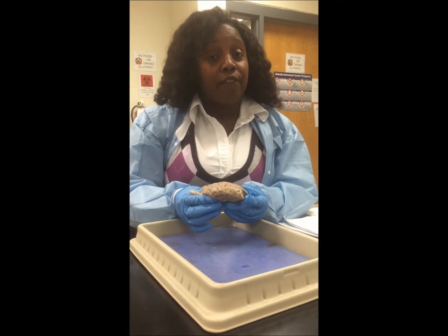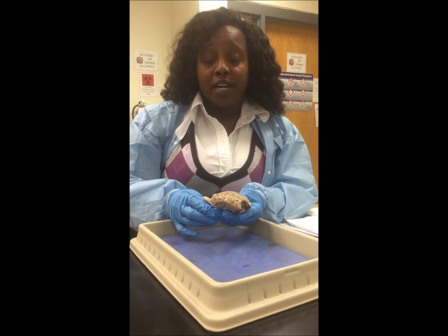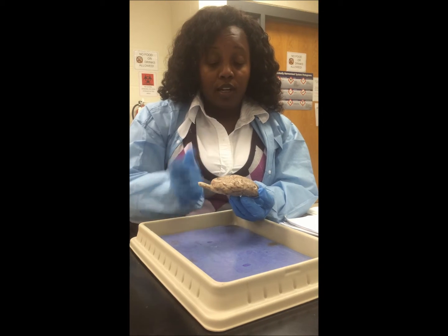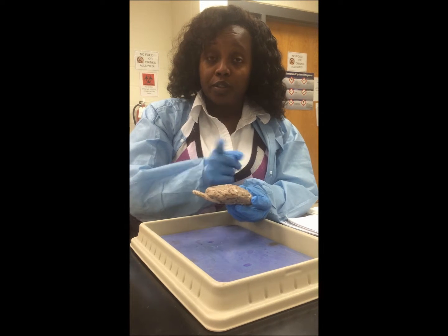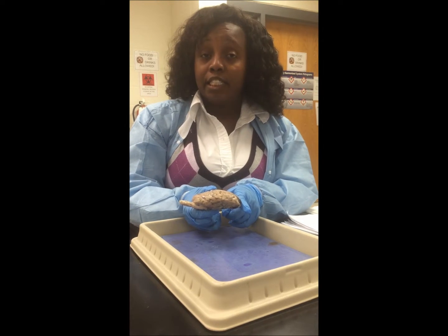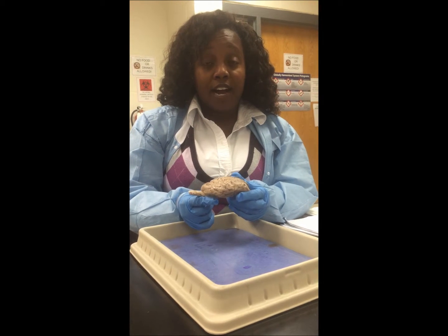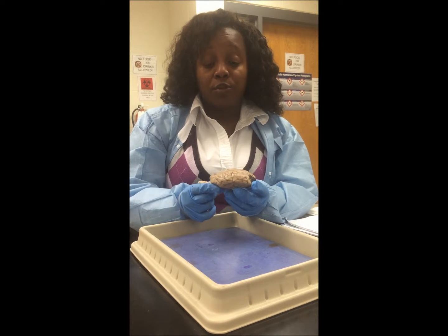The first thing you need to do after you have rinsed off your brain and taken it out of the bag is identify the different directions of the brain. So if we're looking at the brain horizontally, we're going to be looking at a dorsal view and a ventral view, which basically means top for dorsal and bottom for ventral. We'll also be looking at a rostral or anterior view, which means front, or a caudal or posterior view, which means back. So once you identify your different directions, let's start looking for the major regions of the brain.